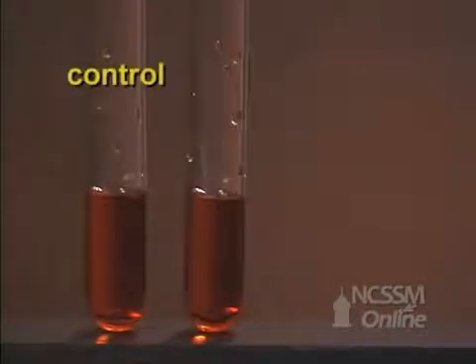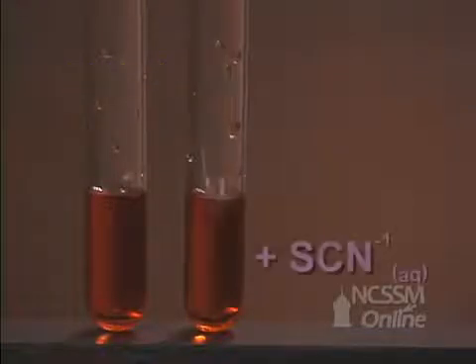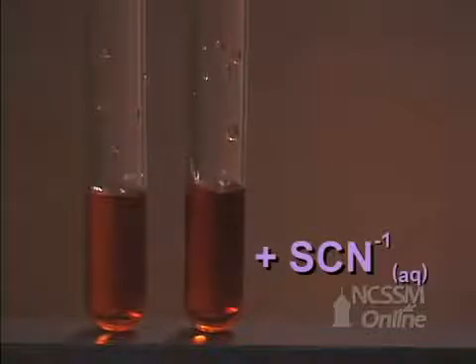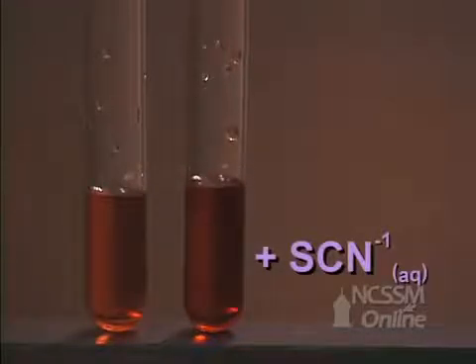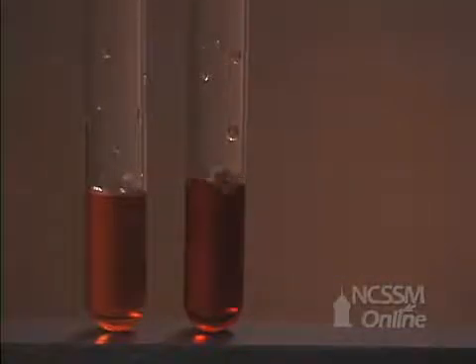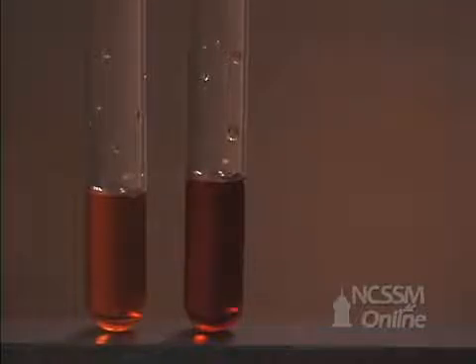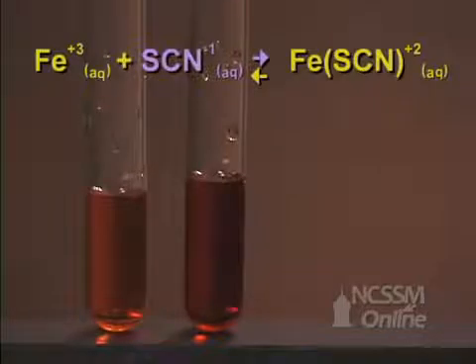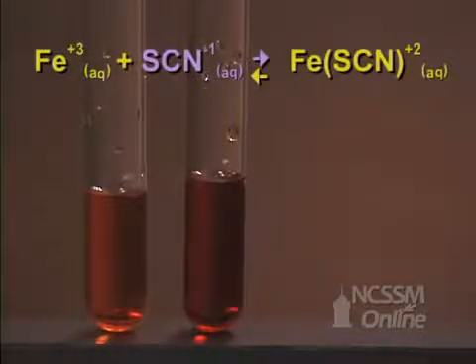Now we'll add 0.1 molar potassium thiocyanate to the second tube. This increases the concentration of the thiocyanate ion. We see that the reaction mixture turns a darker red color, indicating an increase in the formation of the complex ion. We've added the other reactant, the thiocyanate, and the reaction shifts in the forward direction to use up the added reactant.